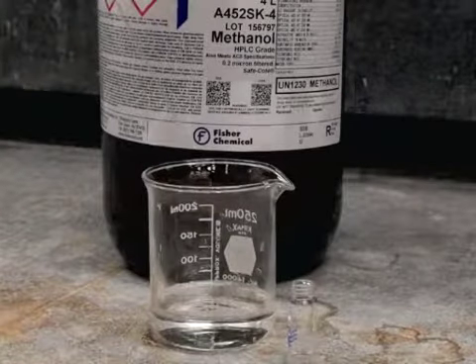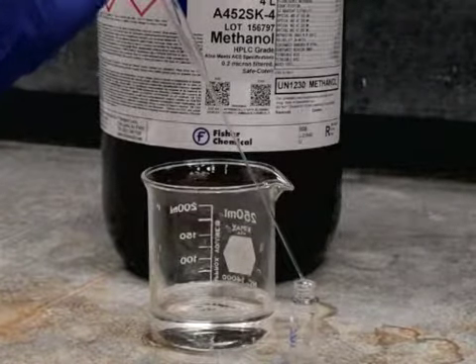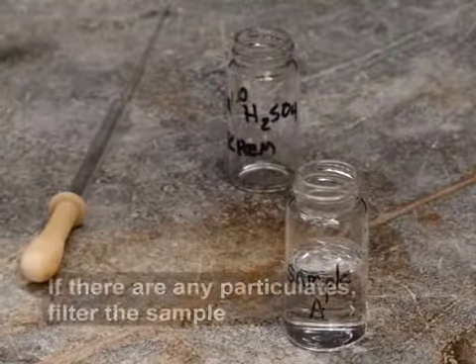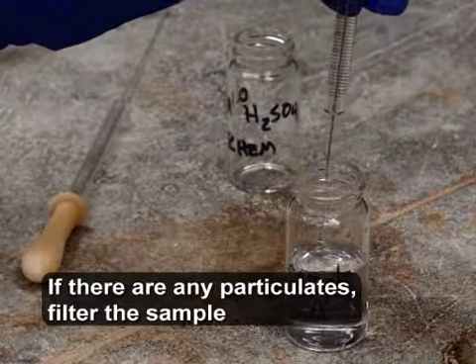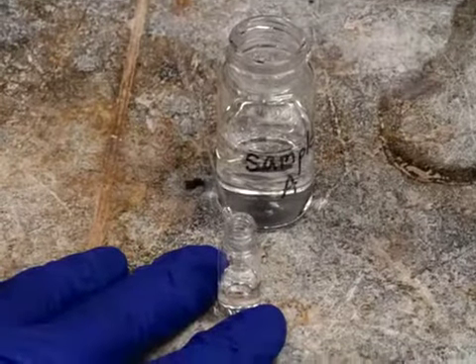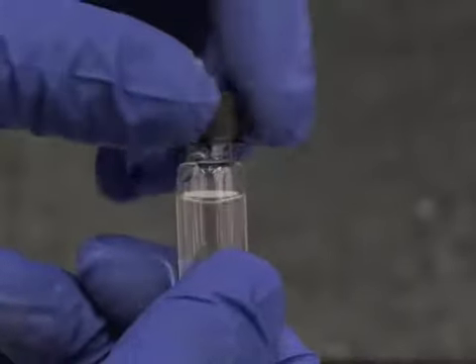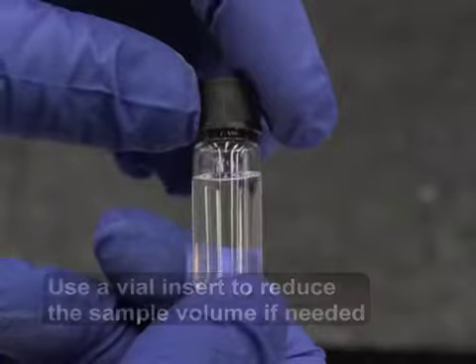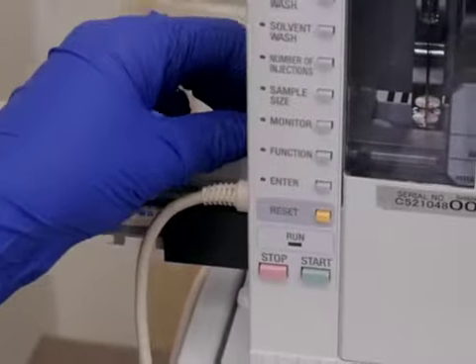To run the sample on the GC, first, fill a vial with a wash solvent, such as acetonitrile or methanol. Prepare the sample, being certain to use glass syringes and glass vials, as plastic residues can contaminate the GC. Now add the prepared sample to the vial with a glass pipette. Fill the vial at least halfway so that the auto-sampler syringe will be fully submerged. Then, load the wash and sample vials into the auto-sampler rack.